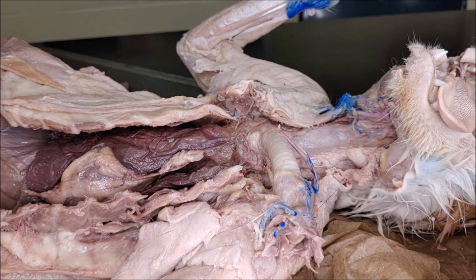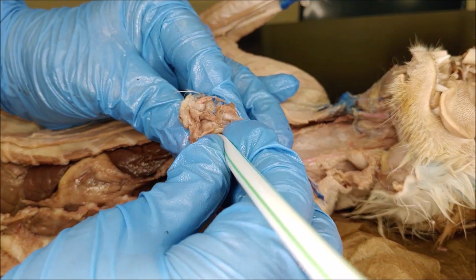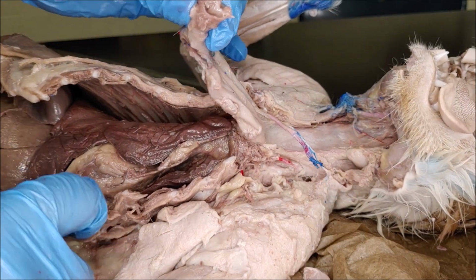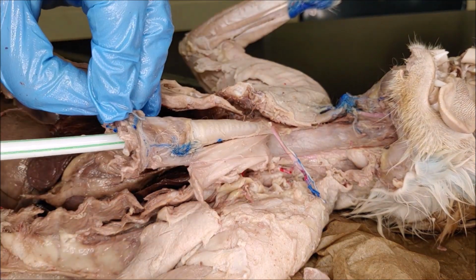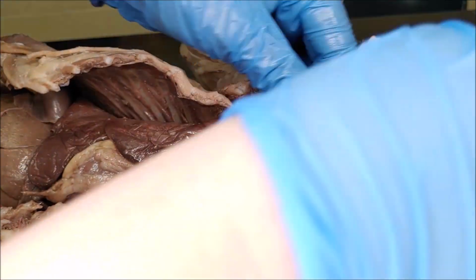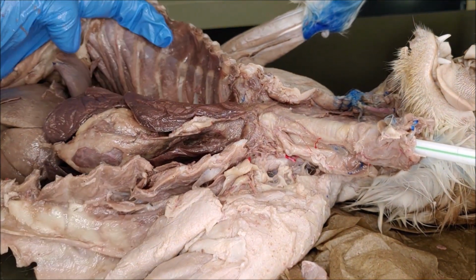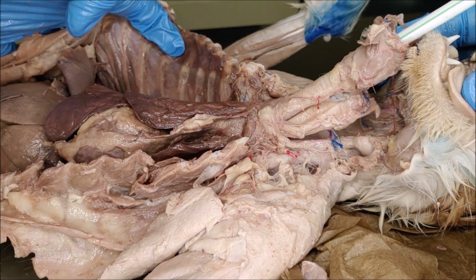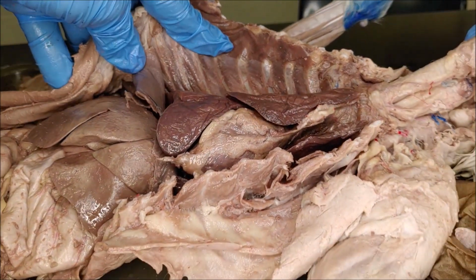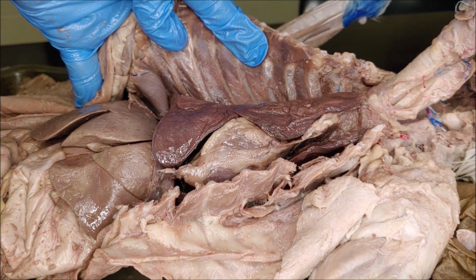And here we can actually inflate the lungs using a straw. I cut the straw at an angle because it makes it a little easier to get in between those vocal folds, because you have to go in between the vocal folds to enter the trachea. So that's what we've done here. We've put the straw in between the vocal folds, and we can feel it in the trachea there. Then just make sure that your ribs are not compressing the lungs, because that'll make it really hard to inflate. And then just exhale, don't inhale, exhale into the straw, and then you can inflate the lungs.